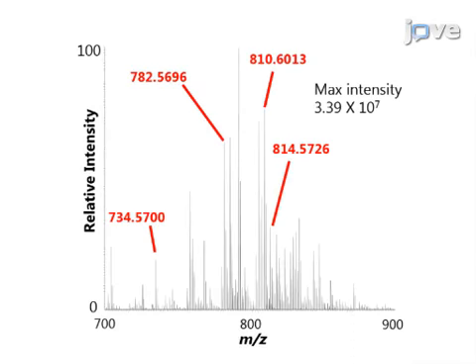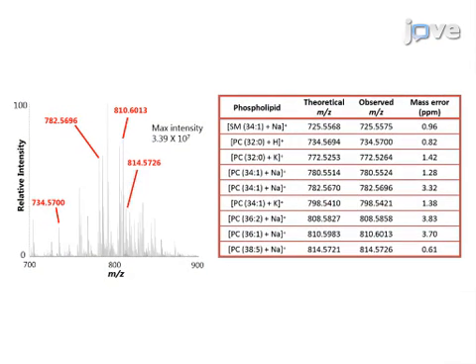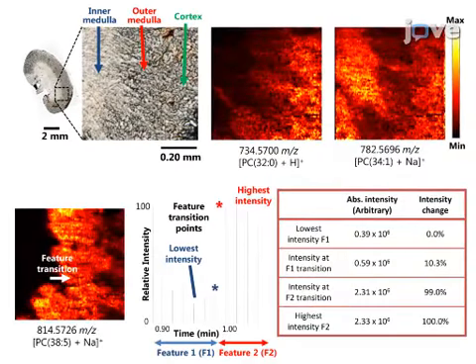The ambient mass spectrometry imaging of mouse kidney sections was performed, and a large number of molecules present on the tissue surface can be detected. The spatial distribution and relative abundance of multiple molecules on the tissue surface were plotted. A spatial resolution of 8.5 microns has been achieved through the observation of sharp transitions of features present within the mass spectrometry data.